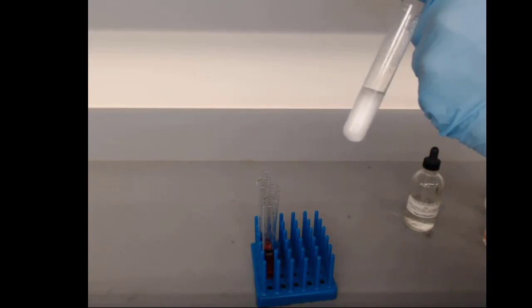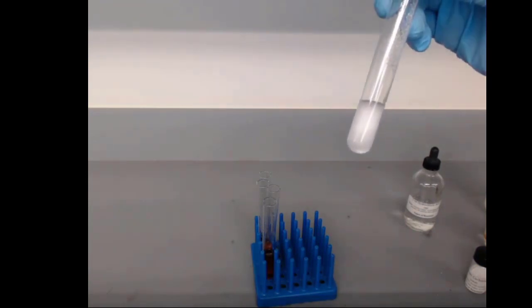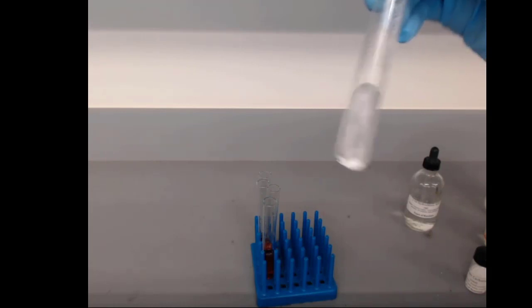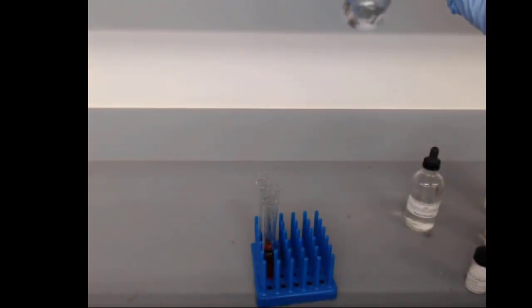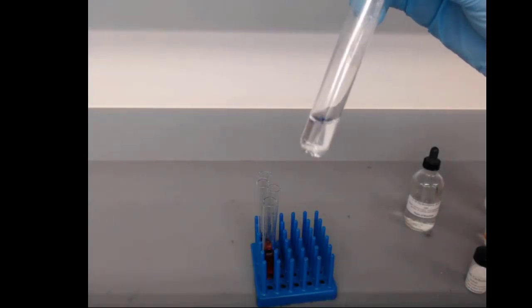Nice violent reaction there, lots of bubbles. You can see very clearly that production of carbon dioxide. As the concentration of the acid gets lower, because the acid is reacting away, the reaction gets slower and slower, and eventually it stops. And you can see that sodium carbonate in the bottom still. So I put in too much sodium carbonate compared to the moles of acid that were in there. The chemical reaction was really clear and obvious.